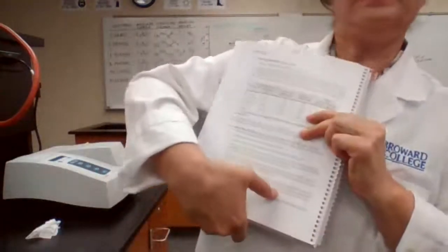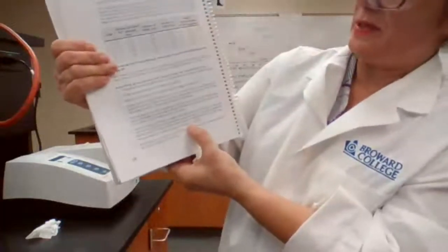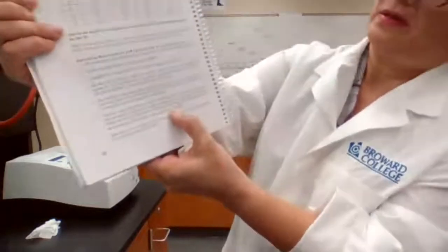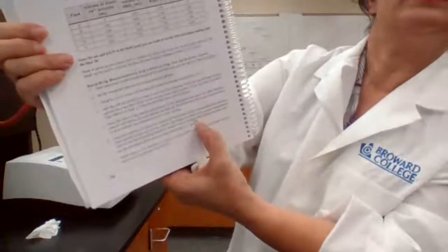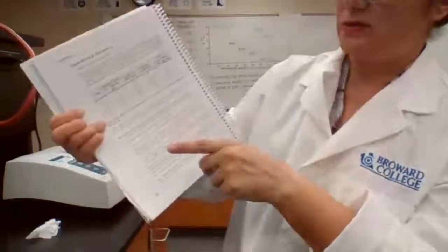The formula to convert the percent T that we are measuring into absorption is in step 6 of the procedure. Okay, A equals log of 100 divided by percent T. That's the one that you are using for all of these values. The percent T that I'm going to report to you, convert it first before you plot your calibration curve.